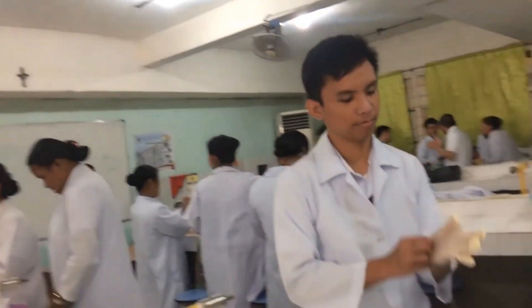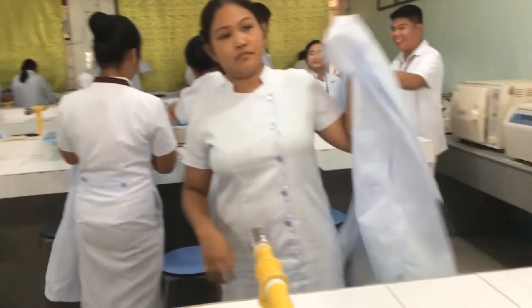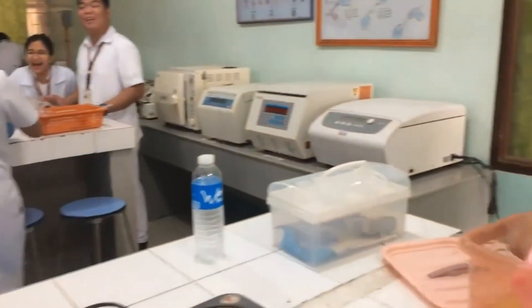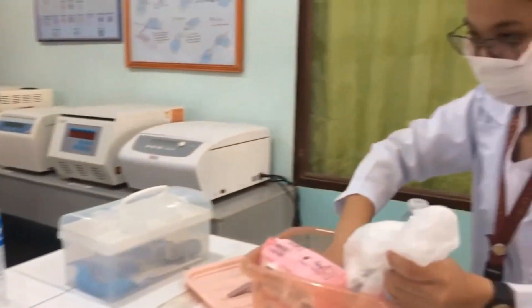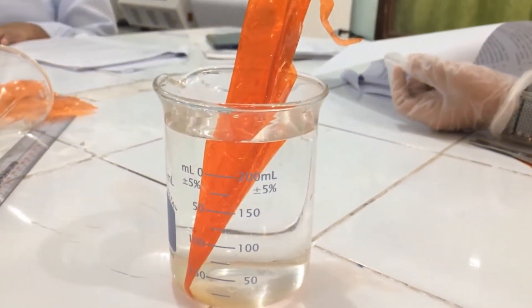Let us simulate dialysis as used by cells. Afterwards, let us test for the presence of proteins and any other large molecules. In this case, let us use milk as the sample. Let us start by soaking 1 square foot of cellophane in water for a few minutes. Afterwards, fold it like a filter paper and fit it in a glass funnel.